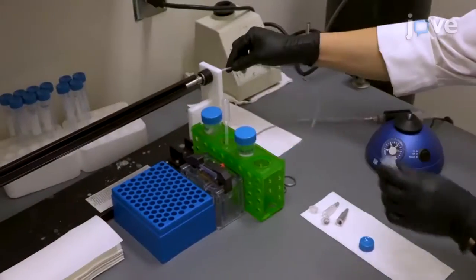This protocol makes it possible to evaluate potential morphological alterations in neurons and dendritic spines that may underlie neurochemical and behavioral abnormalities.